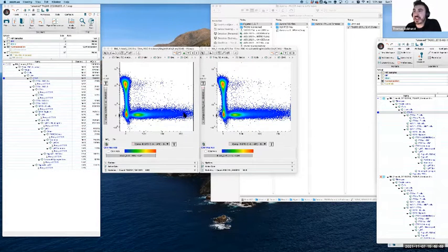It changes the way we see the nature of the data. Any type of scale is really a compromise. Logarithmic scales and bi-exponential scales allow us a compromise of seeing the high and low stuff in a way that is reasonably relevant biologically. But it is a compromise. We actually do lose some information by viewing it that way.